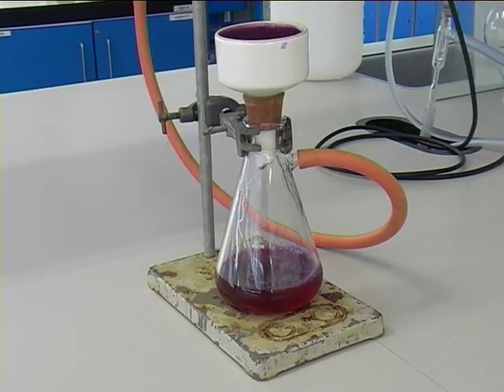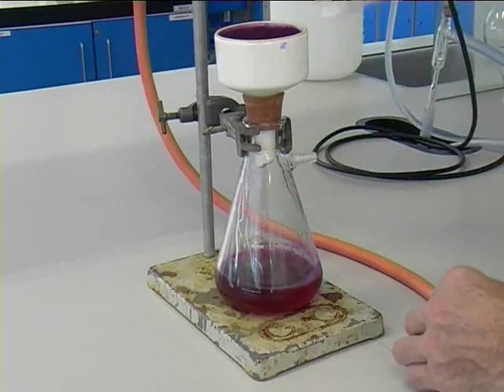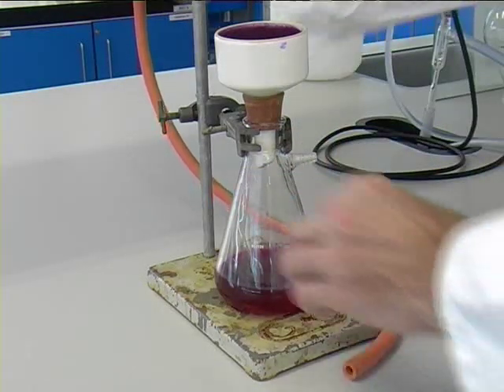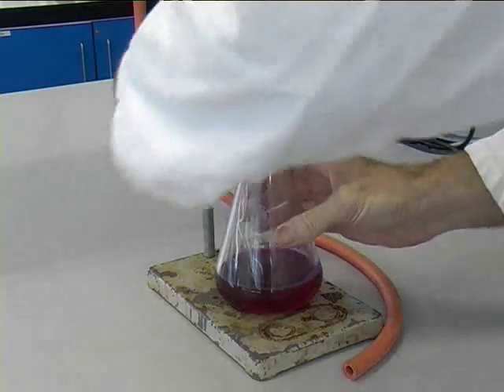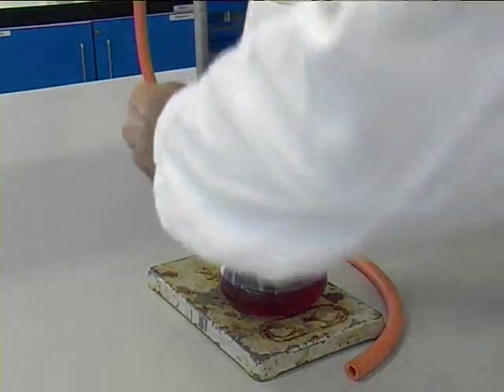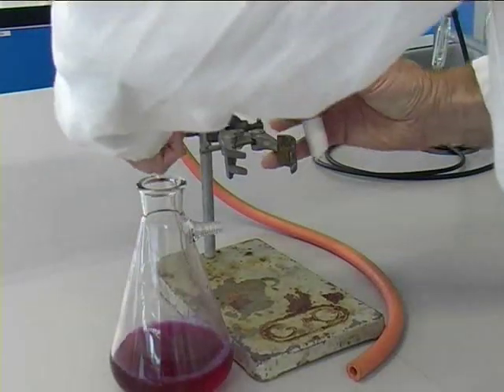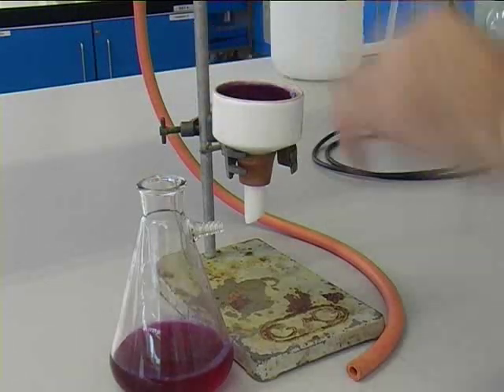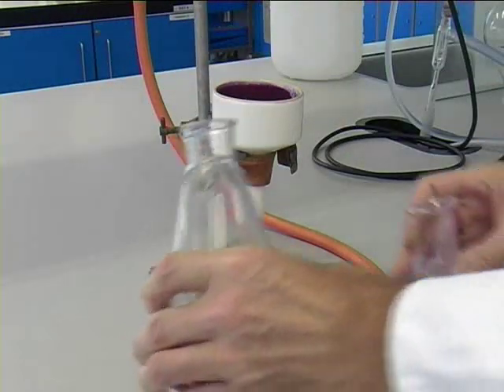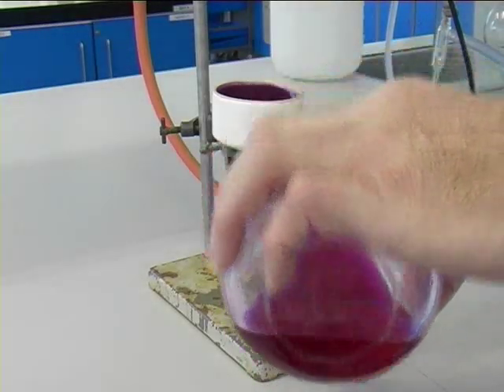The following portion of this clip shows you how to dismantle the Buckner equipment. First, remove the rubber tubing, then turn off the vacuum tap. Unclamp the Buckner flask, removing the porcelain head. It helps to keep the porcelain head upright on the clamp, making sure you don't lose any of your product. Now we will wash the remaining solids out of the conical flask using the filtrate.